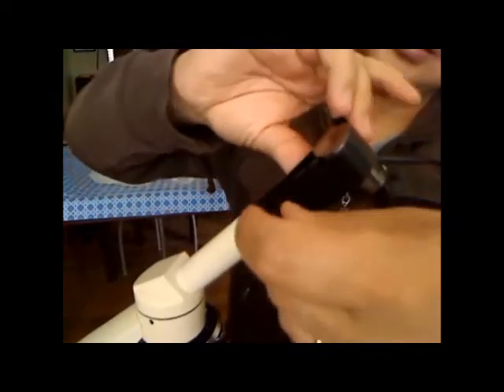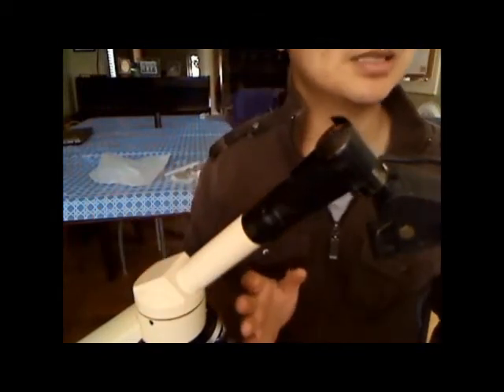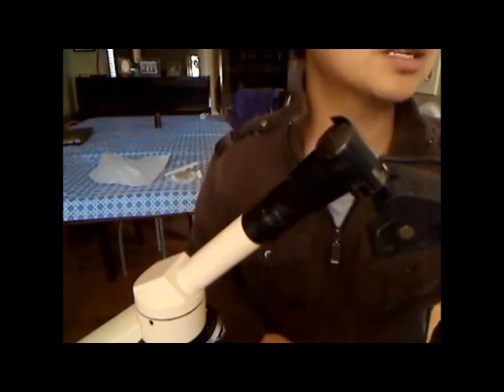Okay, we're done — so simple, took me less than five minutes. Now we're going to look under the microscope. What you see here is a low-power view of a corn root tip. You can see little dots surrounding the root tip — those represent the nucleus of a cell. We won't be able to see much detail at low power because this camera is VGA mode, 640 by 480 pixels.